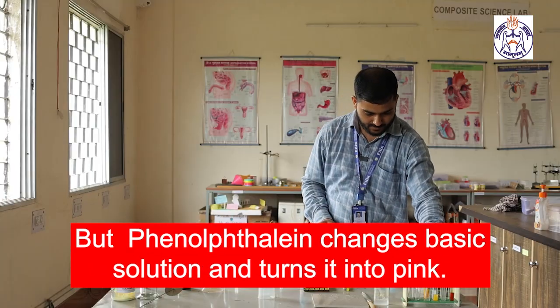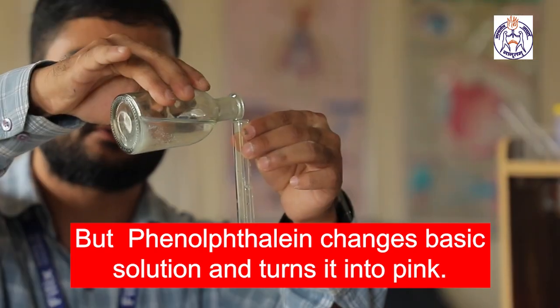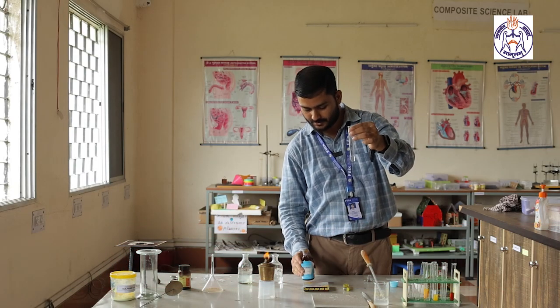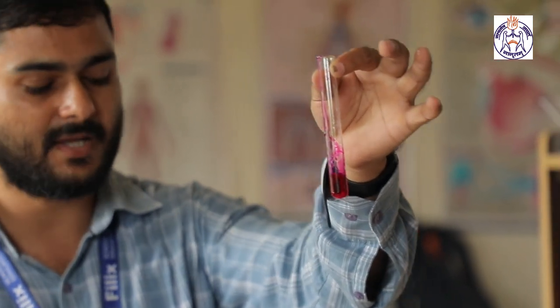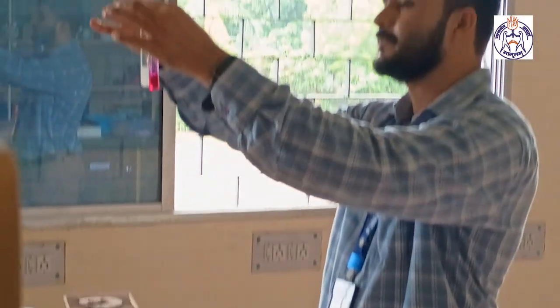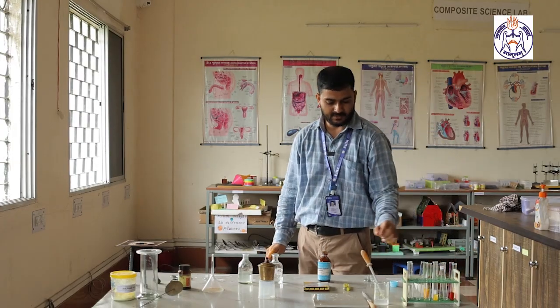But in presence of base, I am taking the base in another test tube, that means our same sodium hydroxide solution. I am adding just 2 to 3 drops of phenolphthalein indicator. There is a deep pink color. So with acid, it is colorless, and with base, it is deep pink in color. In that way, we can observe the acidic and basic nature of any substance.